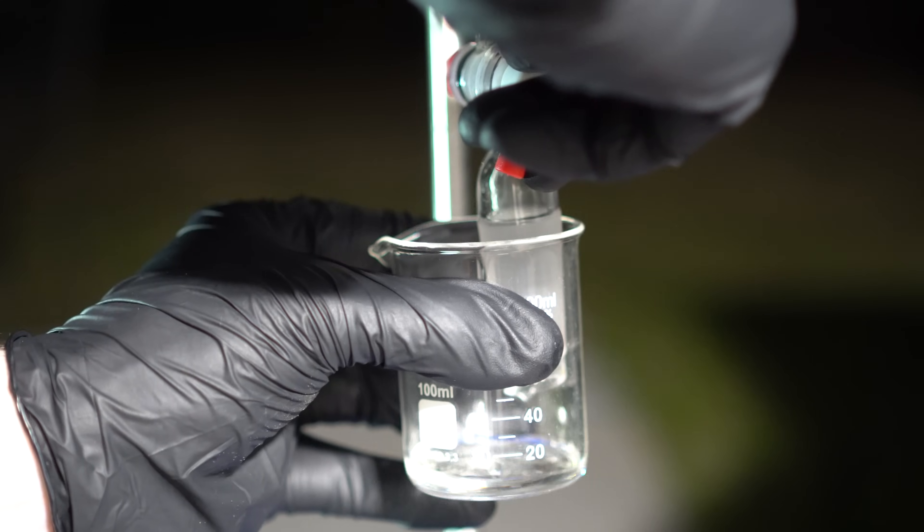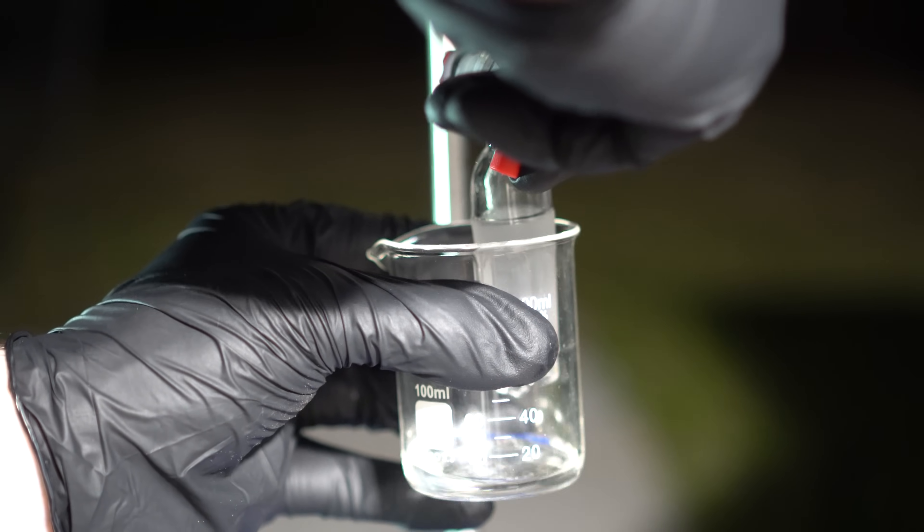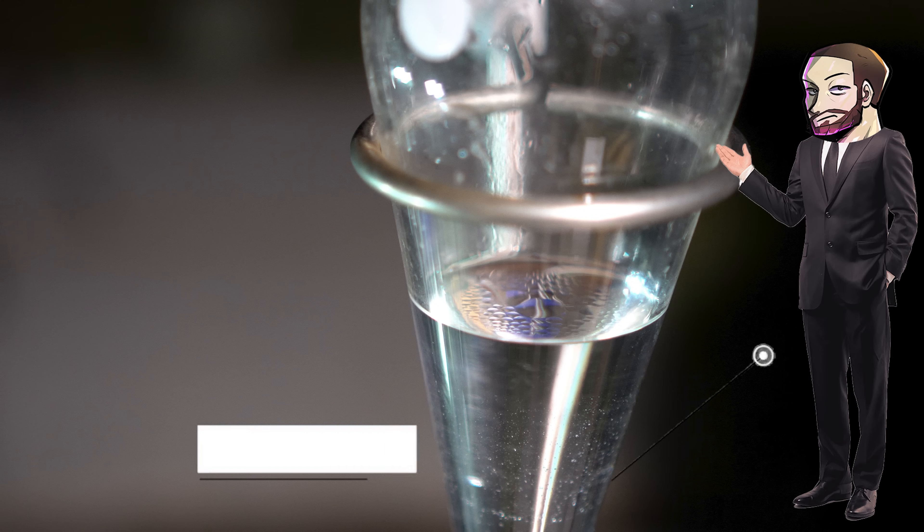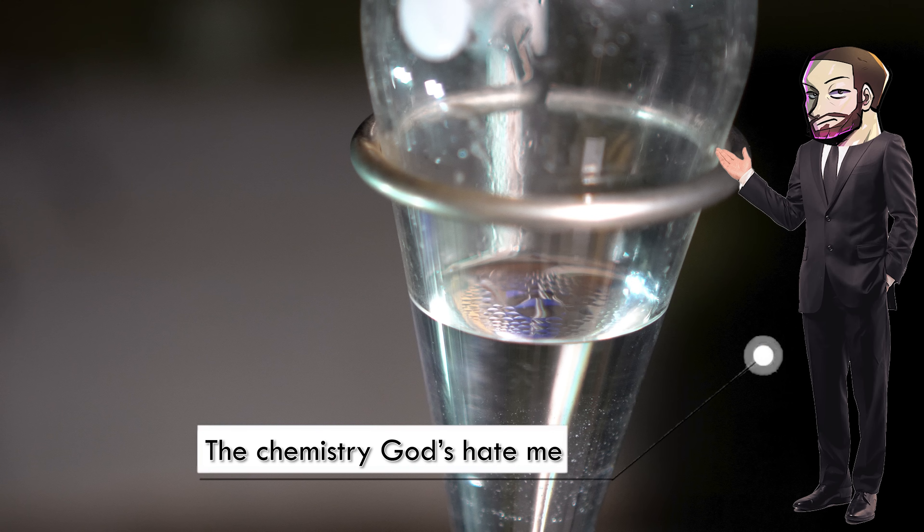Unfortunately, some of the iodomethane also decided to stay on the surface, and I really couldn't get it to go to the bottom, so I just left it there. I should have got that vibrator that I used in one of my other videos.